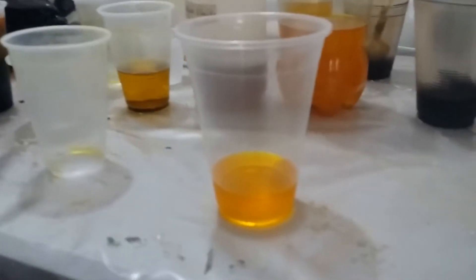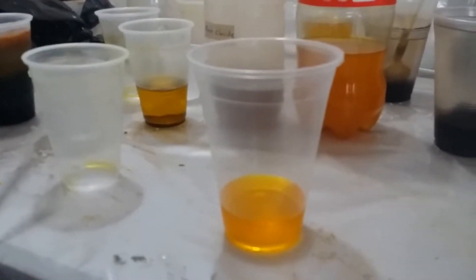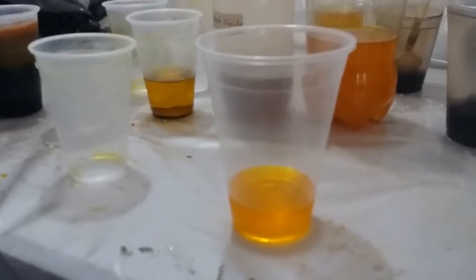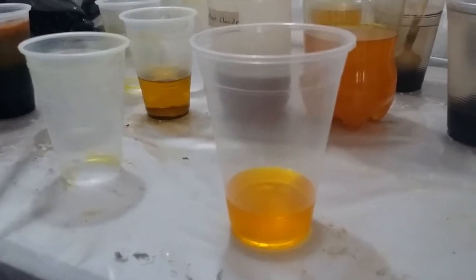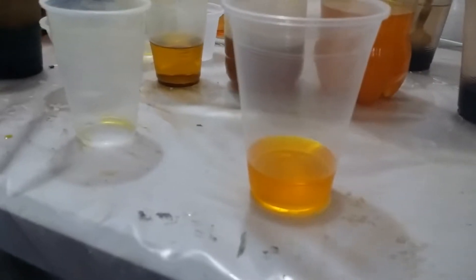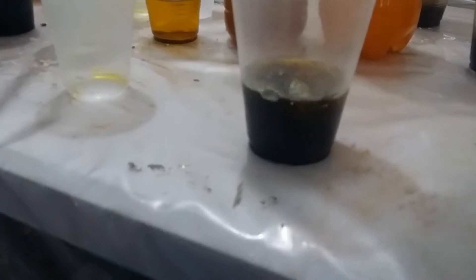Just playing around, I was thinking about Dan's video and some of the comments I made, thinking about his battery. I wanted to play around with some more of the iron oxides, so I thought I'd just try making different iron oxides. So this is what I did.